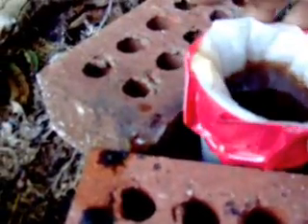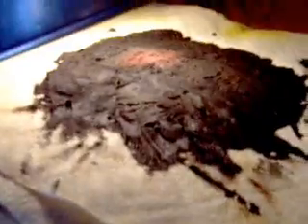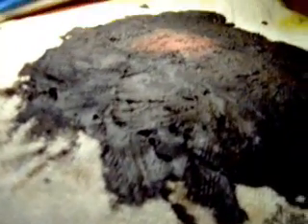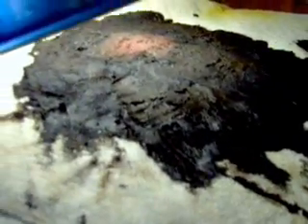Carefully, don't burn yourself because it's pretty hot. Let it filter through for a little bit and then pour some more in. Once you get it all in, take a second coffee filter and put it on top. Weigh it down so it doesn't blow away. That helps so debris doesn't get in. After you filter your rust, put it out on a paper towel or a plate. Put it under a light to dry it off, get it as dry as you can. When you see that red spot, that's where it's getting dry — it looks black but once it dries it'll turn a different color.